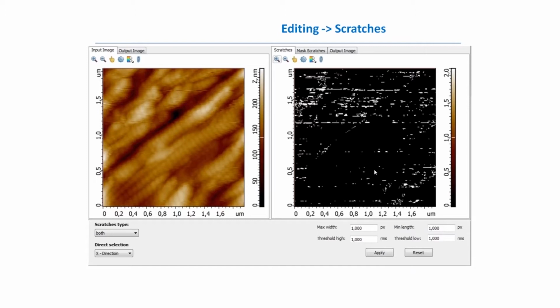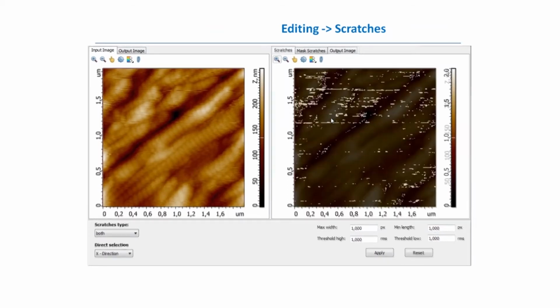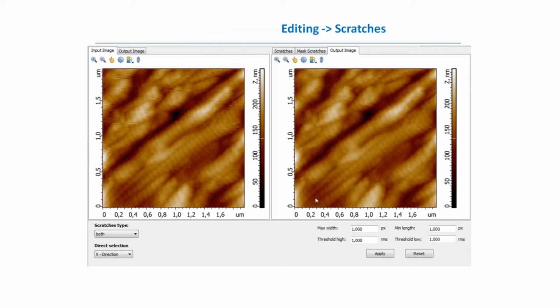But sometimes there are too many lines which should be removed from the image, and you can see it in this example, and it might take plenty of time to do the manual removal. So in this case, the editing scratches method can be used. Here on this example you see from the left side the input image with many line artifacts, and from the right side you see the mask where the method detects these bad lines. And if you look at the output image, you can see that all these lines are removed automatically.